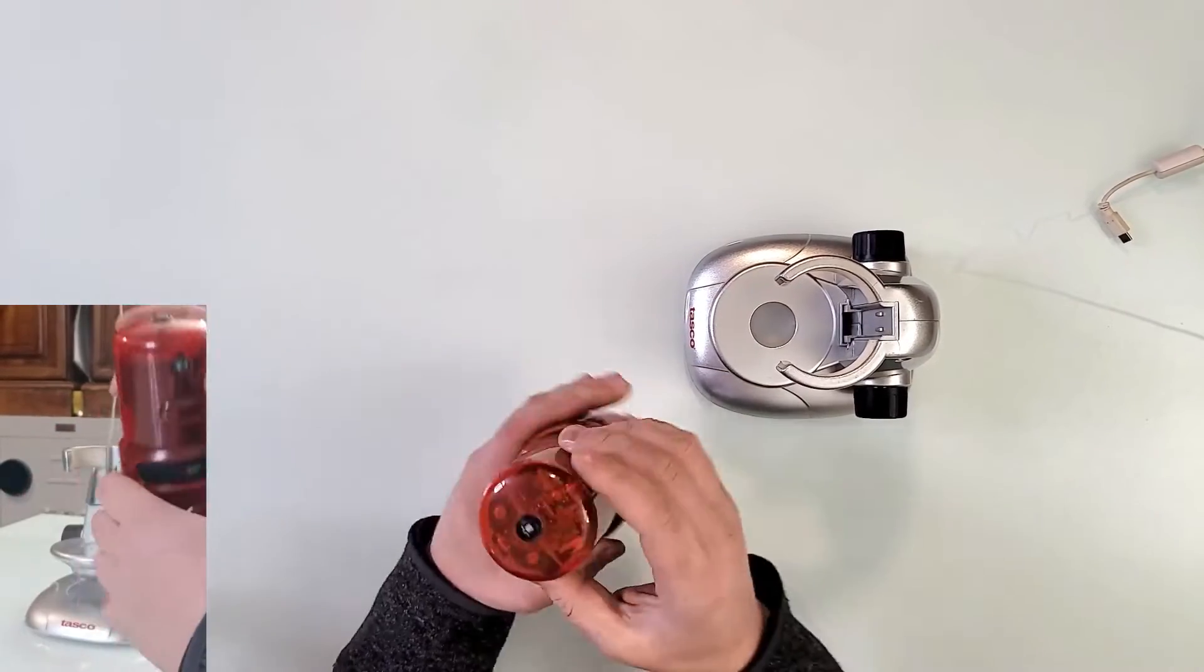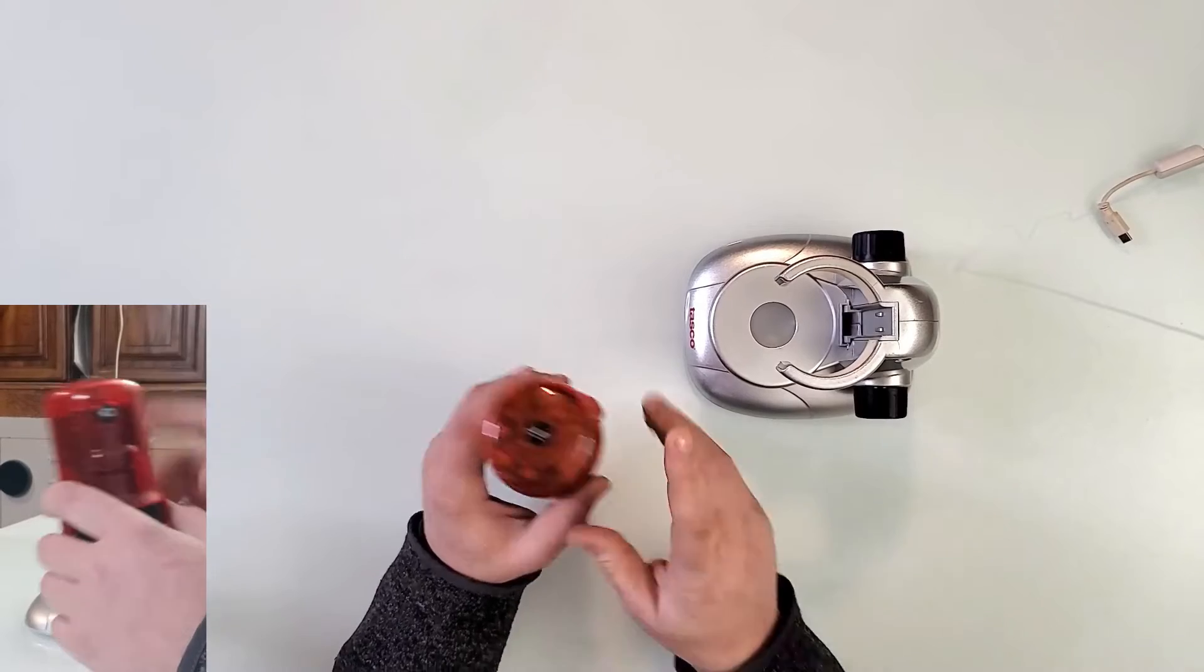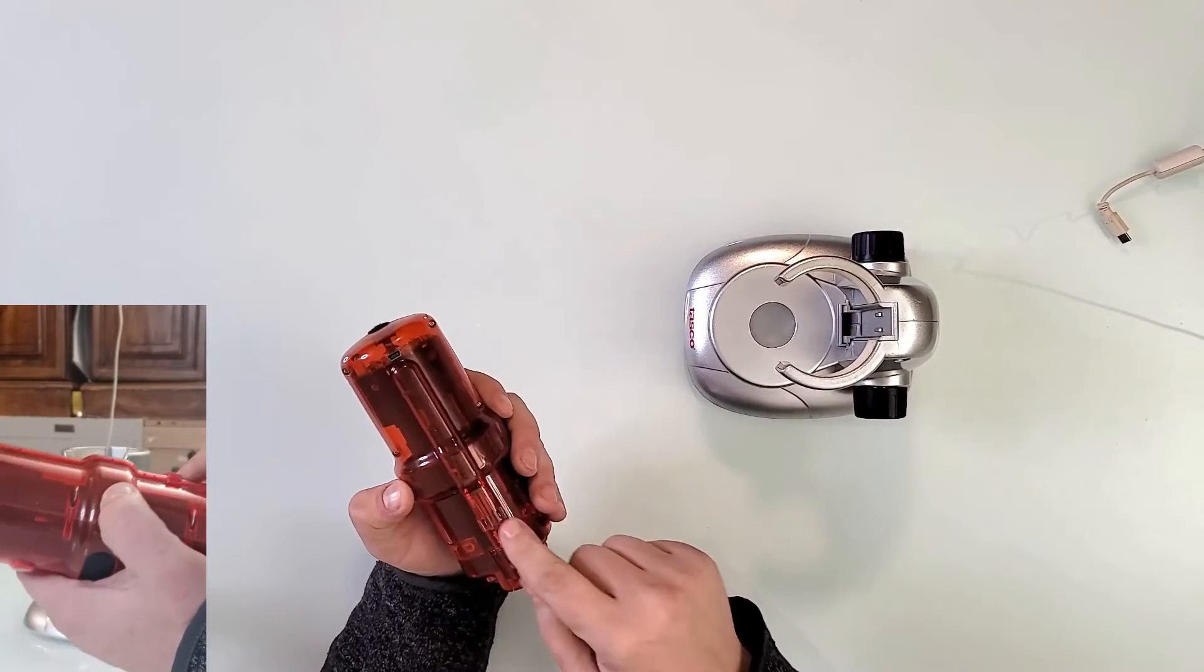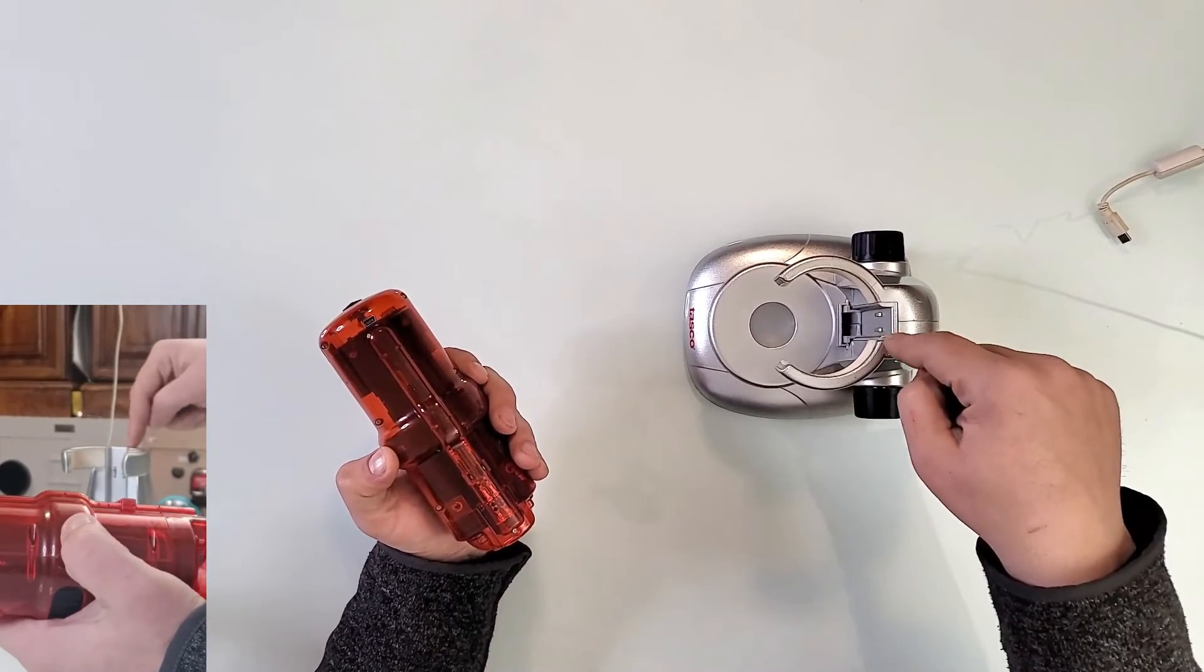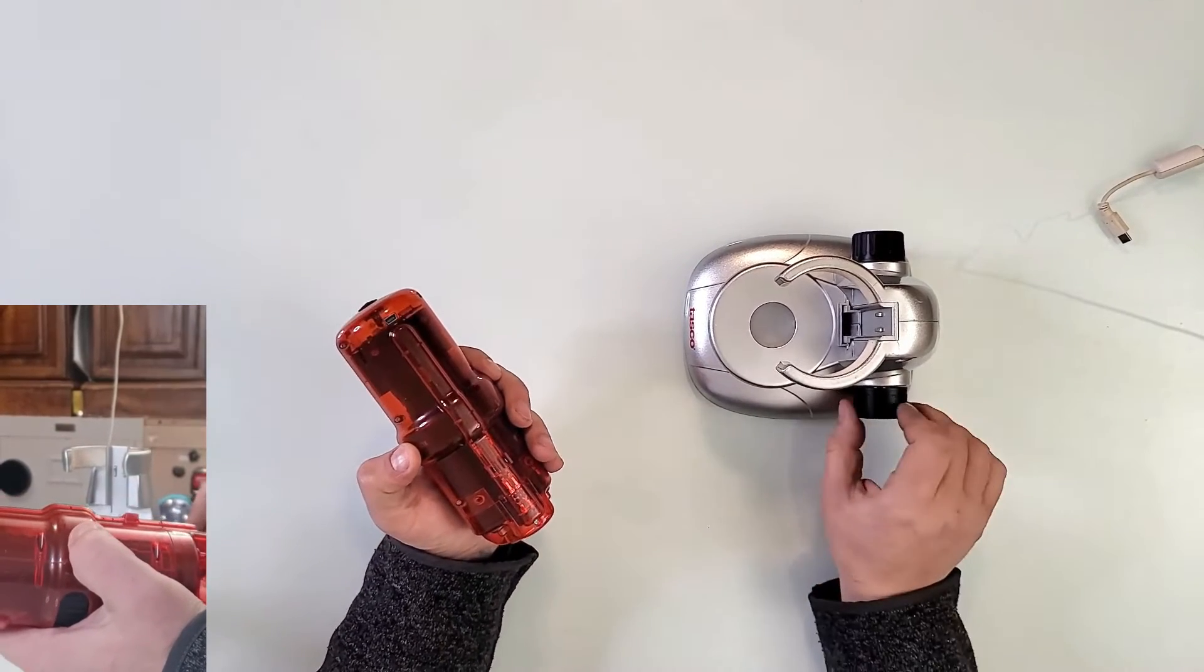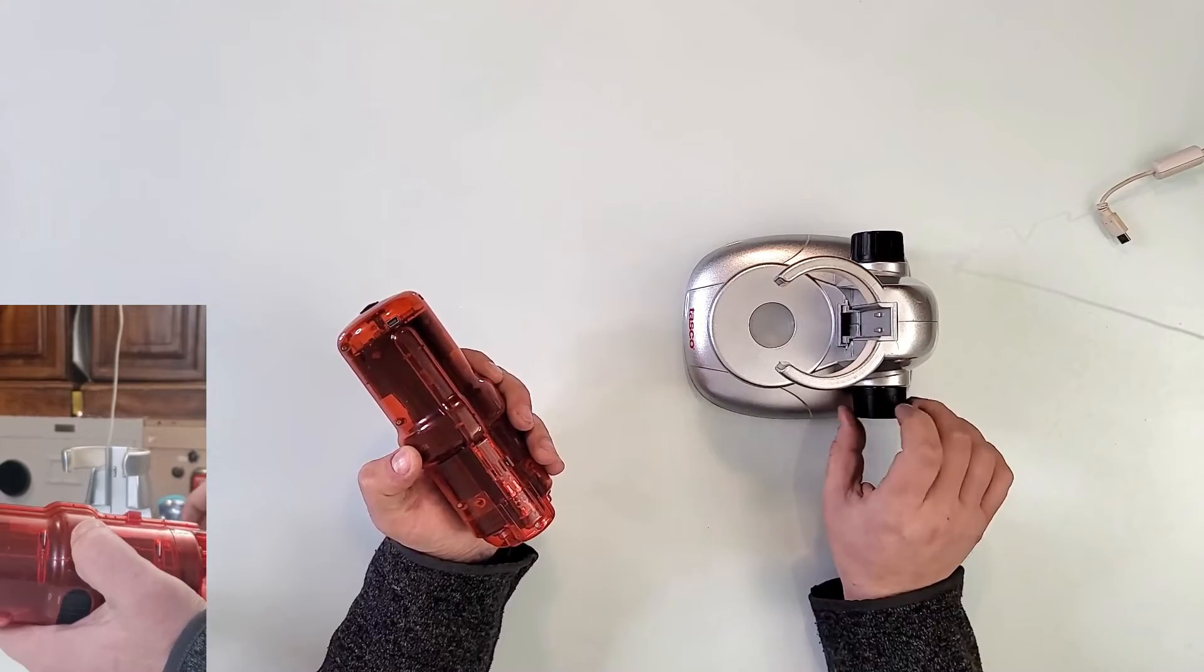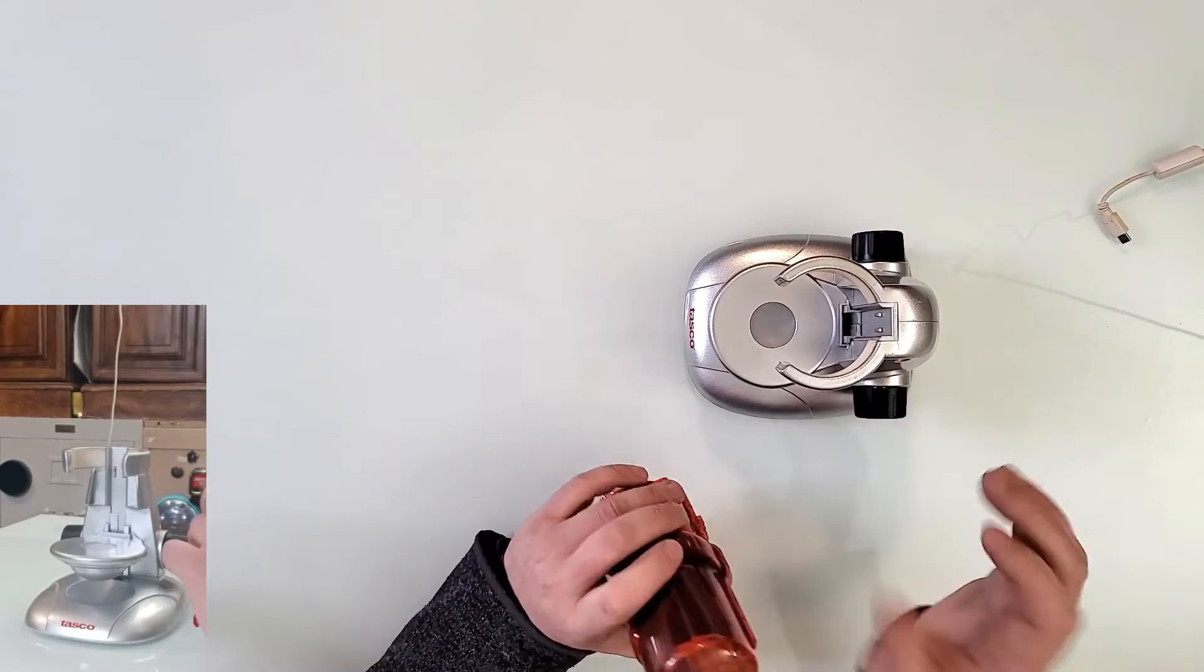Here's the camera, here's the top light and the bottom light. It makes contact here with the rail here, and here's how you fix the clarity.